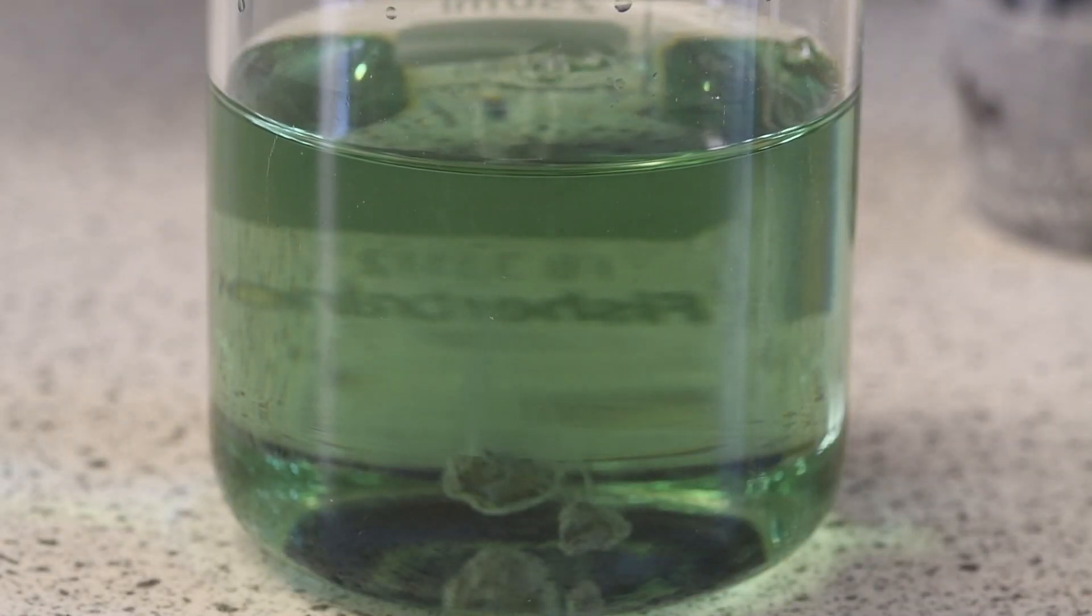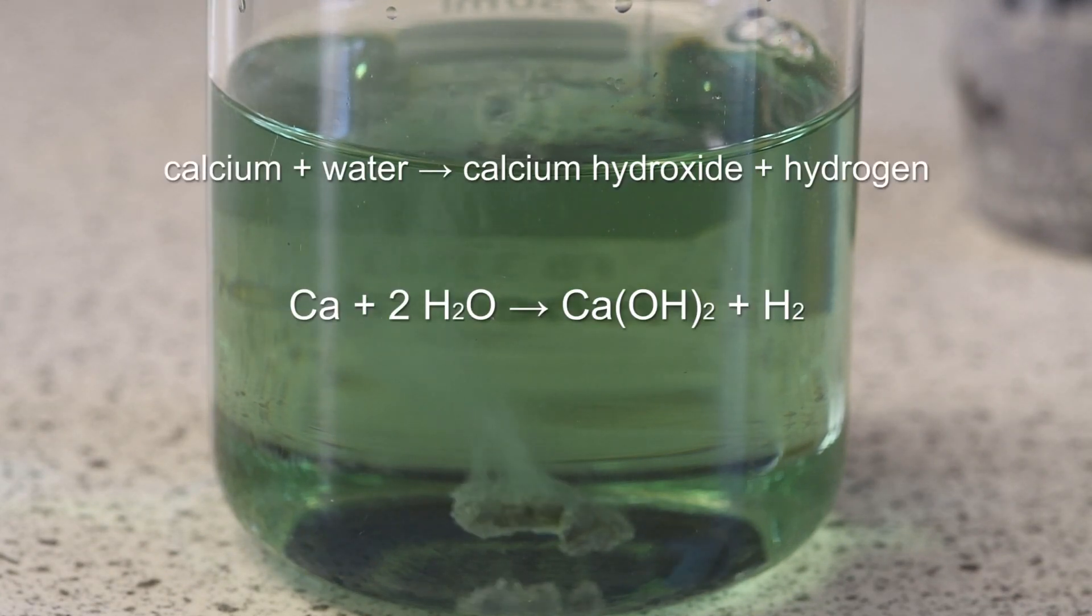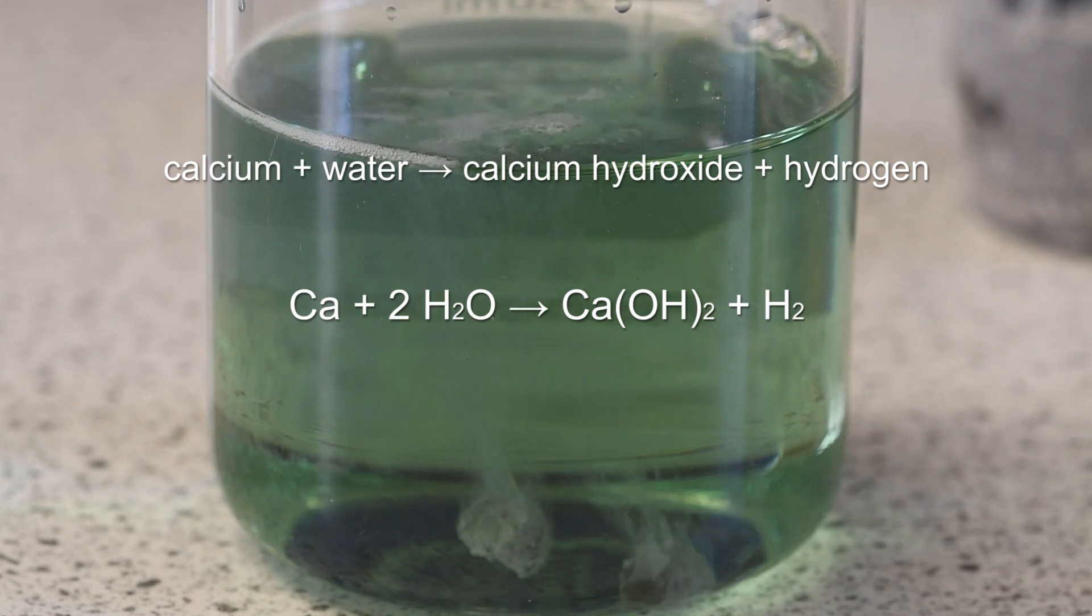So you'll notice first of all that the calcium sinks to the bottom. As it goes into the beaker it starts fizzing. So it's producing a gas, it's producing hydrogen gas.